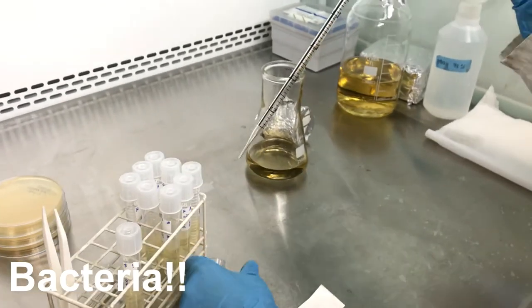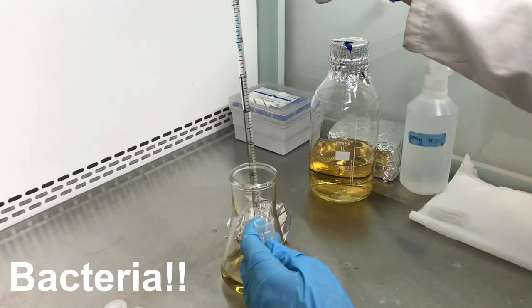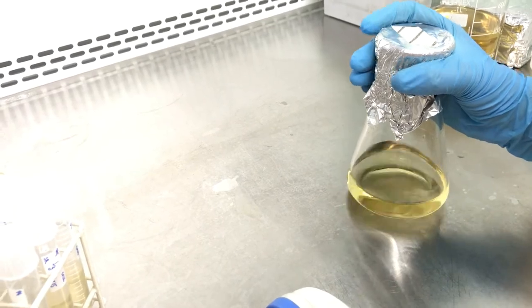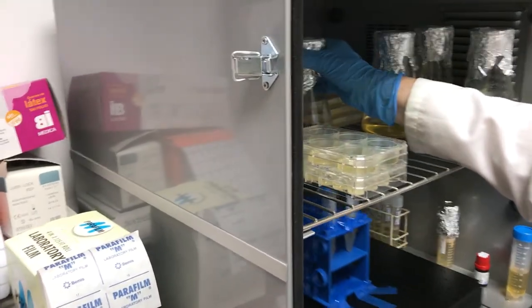We let them sit at 30 degrees for 3 or 4 days. The longer time, the thicker the film will be.